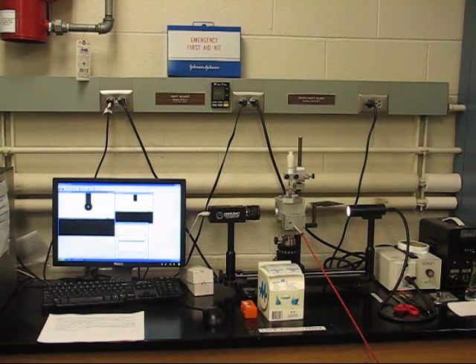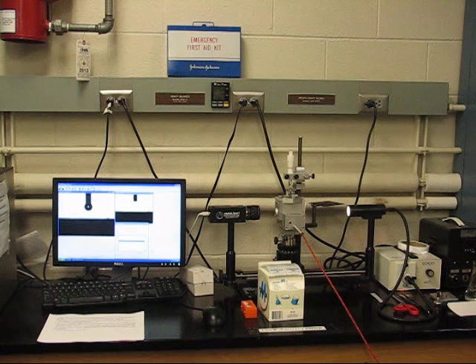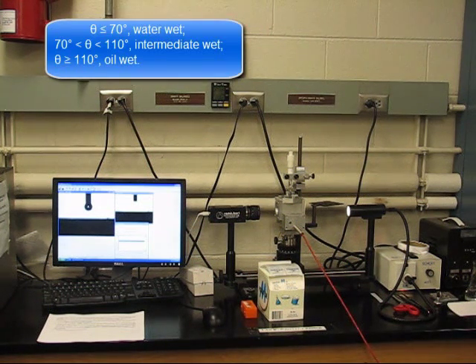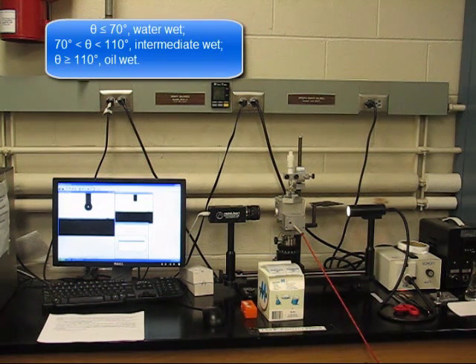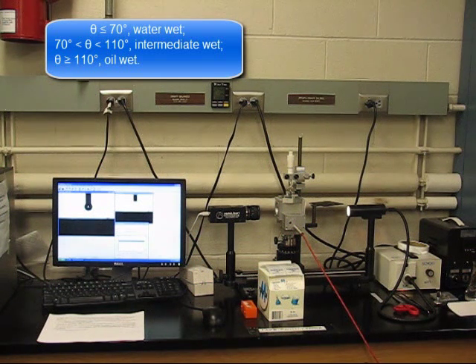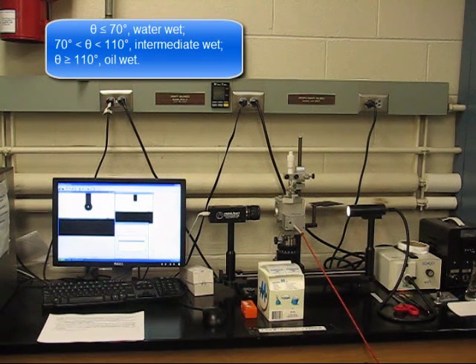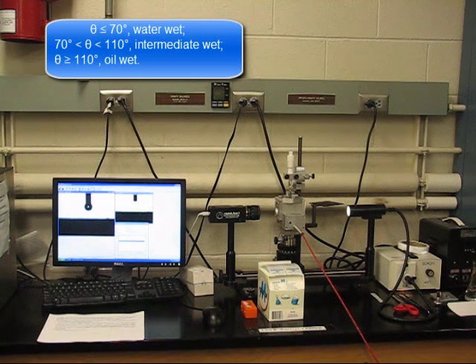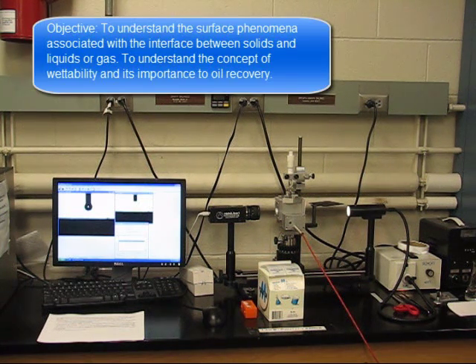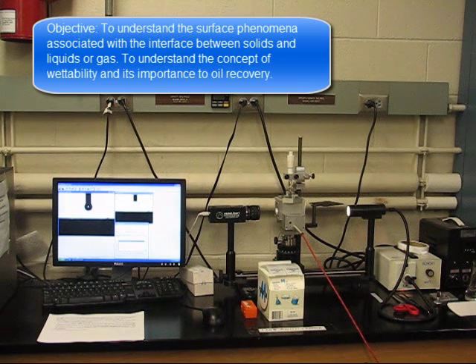The reservoir rock wettability is classified as follows: a contact angle less than 70° is water-wet, between 70° and 110° is intermediate-wet, and a contact angle greater than 110° is oil-wet.